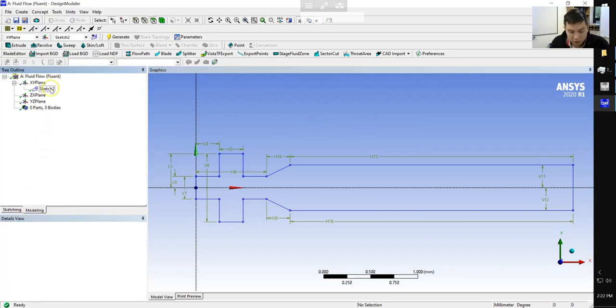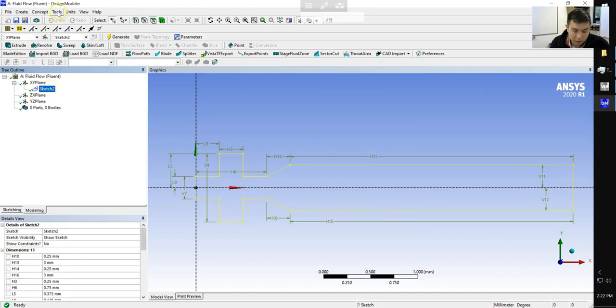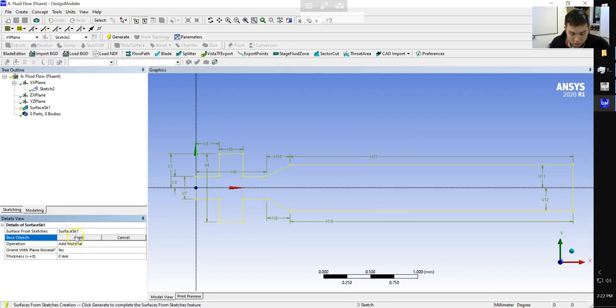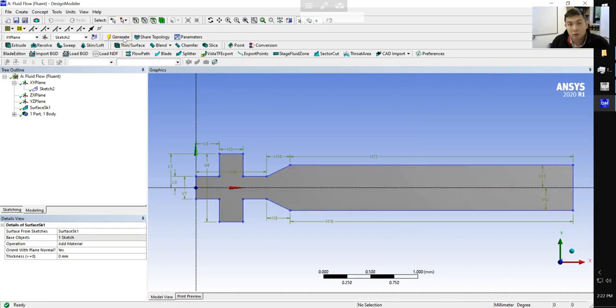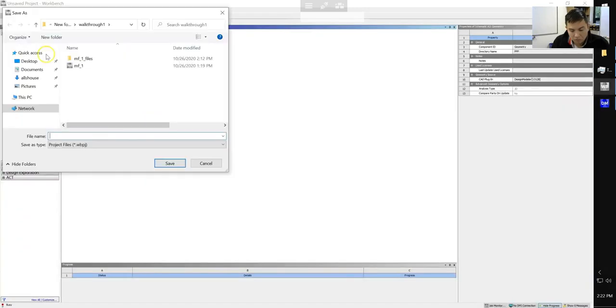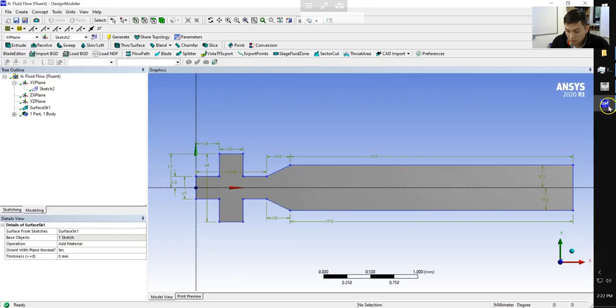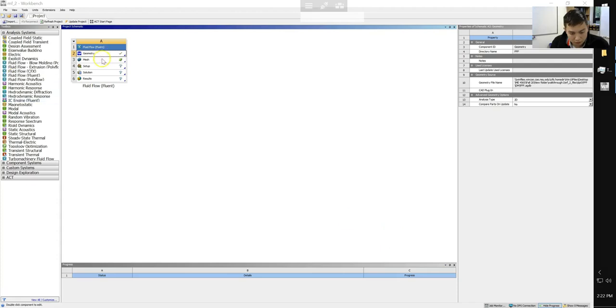So we can go in our modeling, click on our sketch 2, since we had to delete our sketch 1, concept, surface from sketches, apply for our base sketch, and then we can generate and it produces our microfluidic channel. Okay, let's go ahead and save our project. Okay, project is saved. We can close our design modeler and go ahead and open up our mesh.